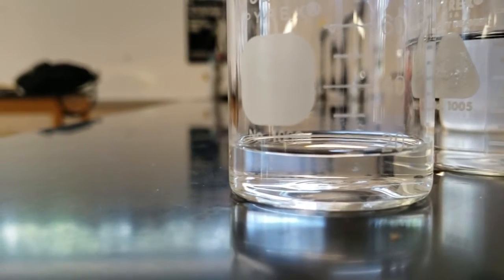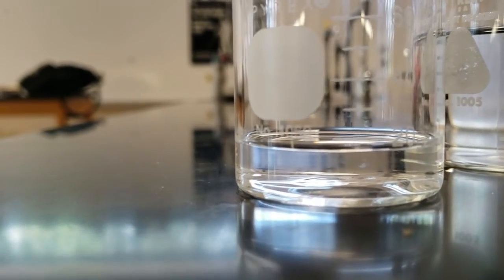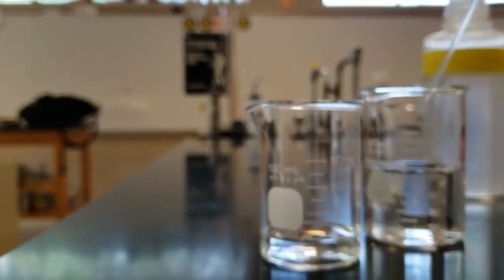We can use our disposable pipette to add or take out a little bit at a time. And we'll just keep putting it back into our 150-milliliter beaker. So here I'm a little short. I need to add some more to it. Get down, get a squat down, and look at it straight on.